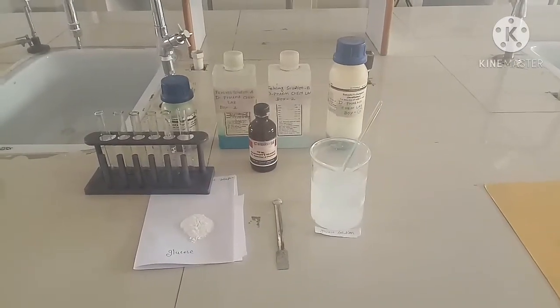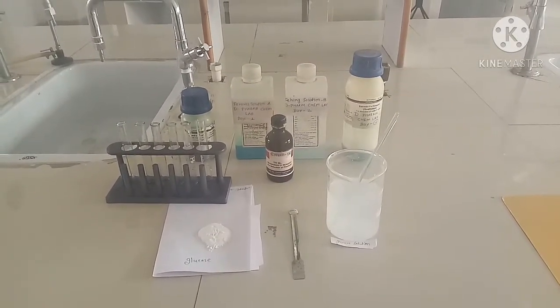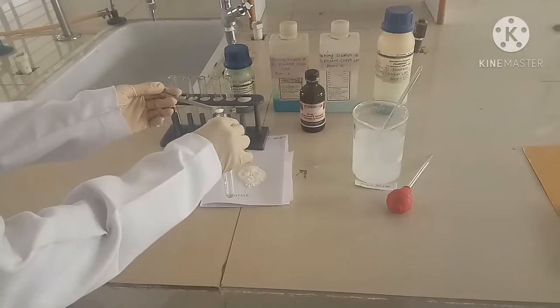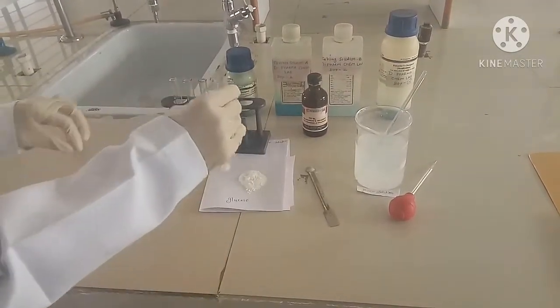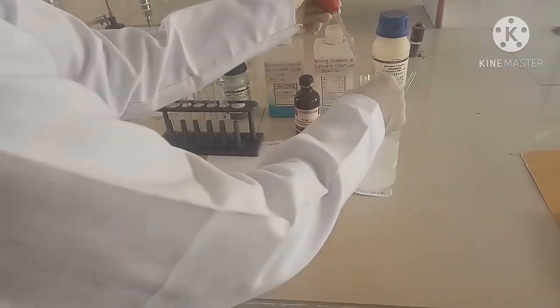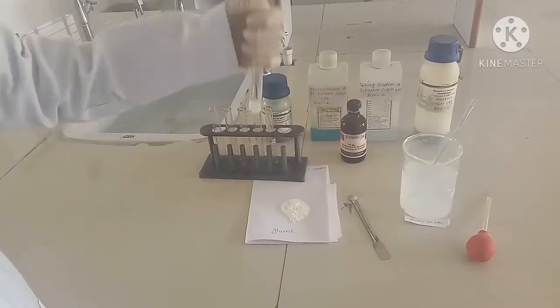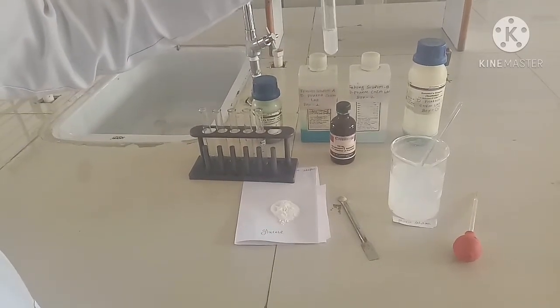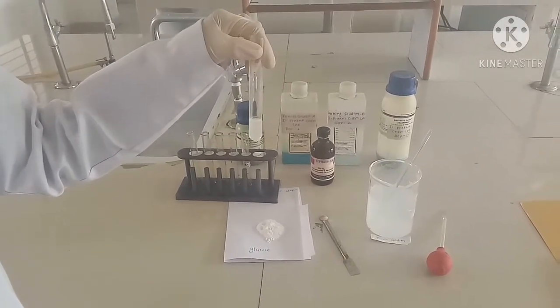Now we will start the solubility test of carbohydrate. Take a small amount of the given sample in a test tube and add 3 ml of distilled water. Shake the test tube well. The glucose is soluble in water.